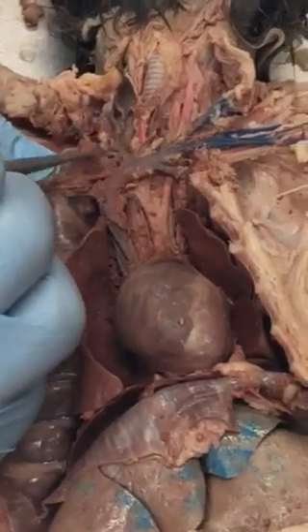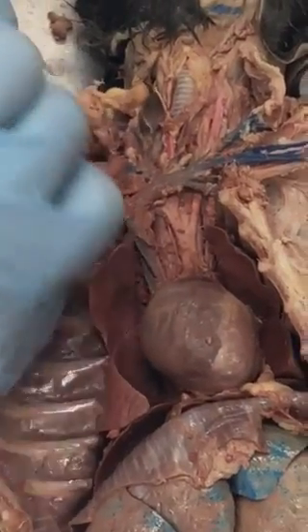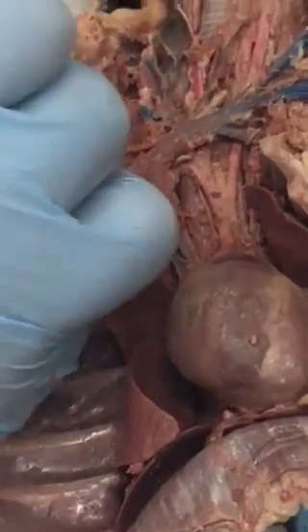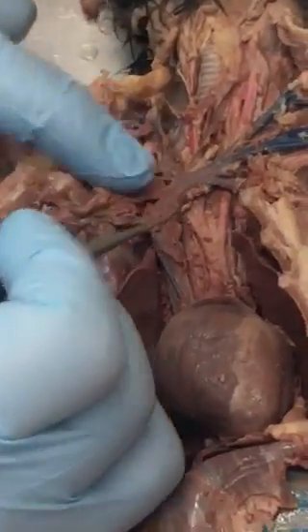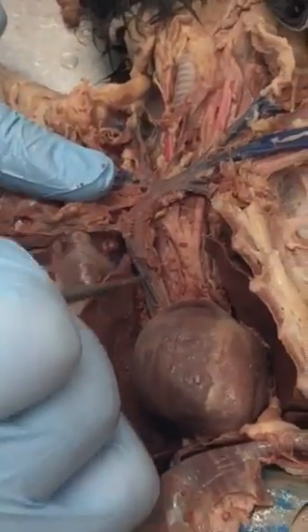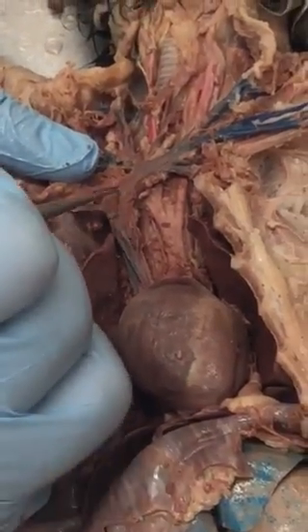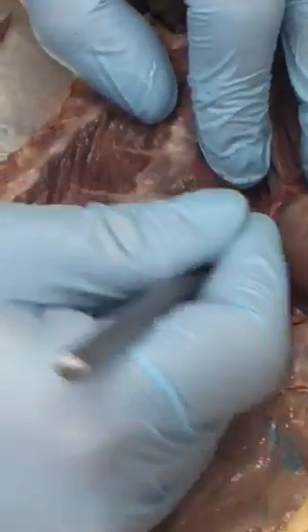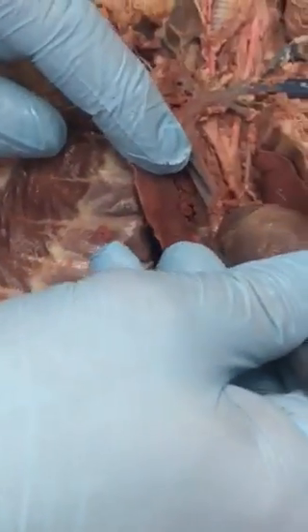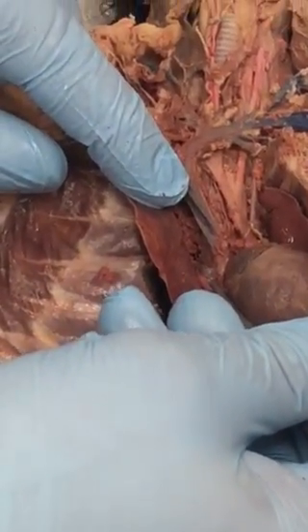If we follow this here, this isn't dissected out well — these aren't showing all that well. This is the superior vena cava. There is a blood vessel that comes right off the base of that — I'm pulling on it right there. That is the azygous.